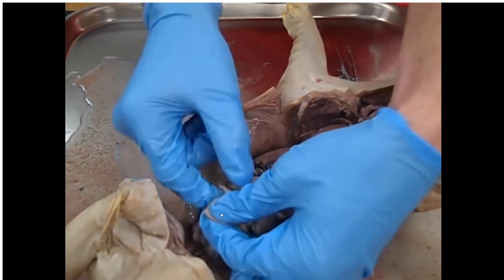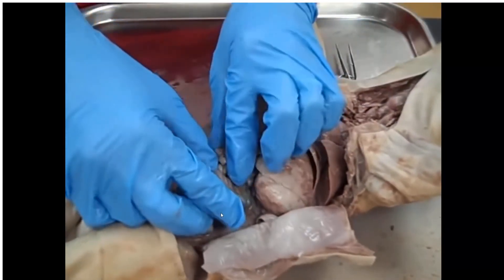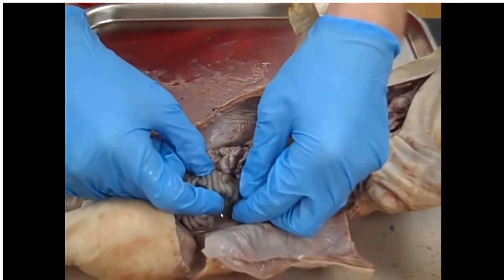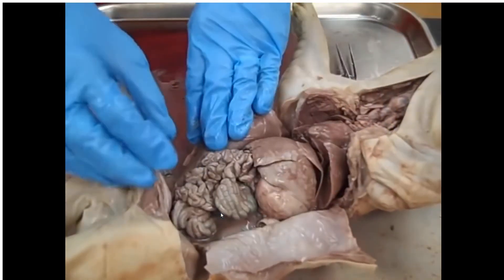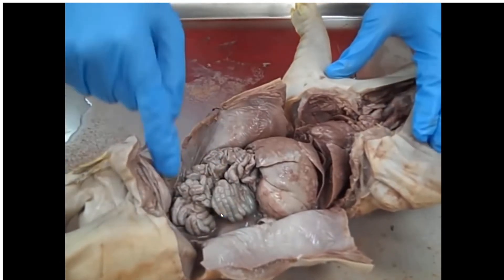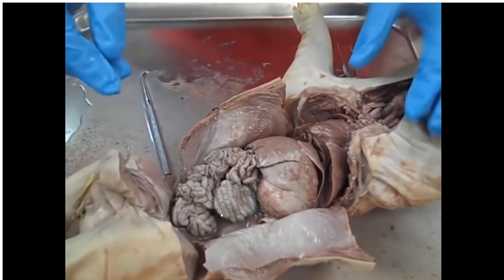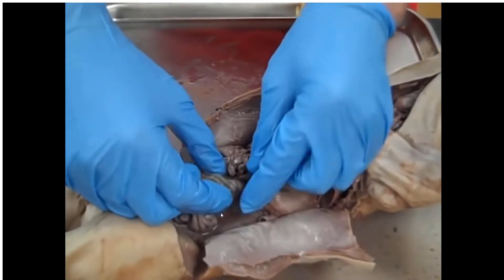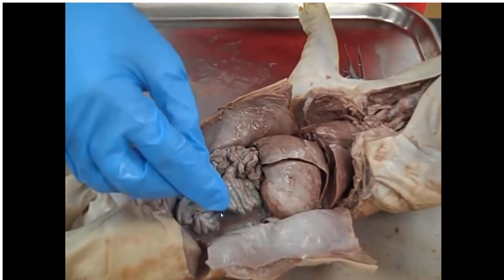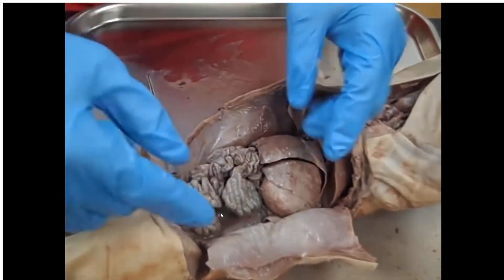With lots and lots of blood vessels running to and from the small intestine to aid in digestion. This organ right over here is the colon — the large intestine. Pigs have a little bit different shaped colon than humans. Humans have the ascending, transverse, and descending colon, and the sigmoid colon going down to the rectum and anus. Pigs have a circularly arranged colon called the spiral colon, and it's held together by connective tissue spirally, like a corkscrew.